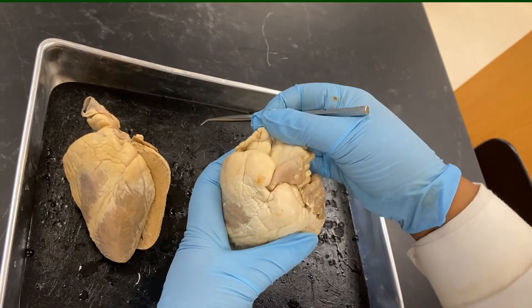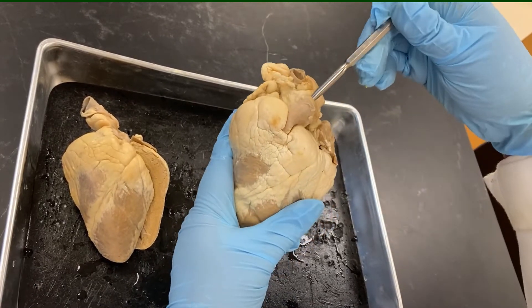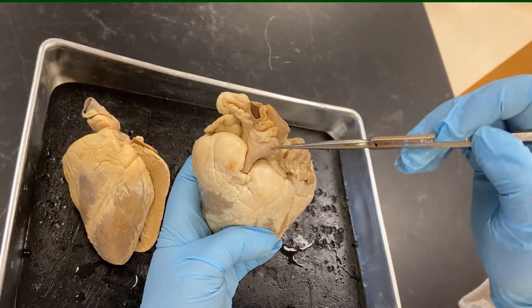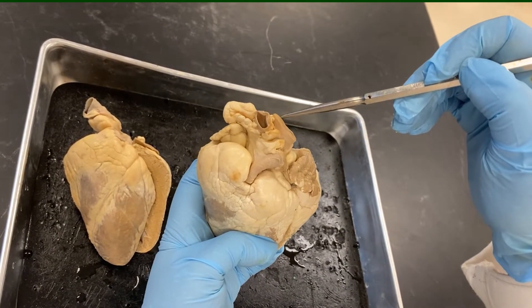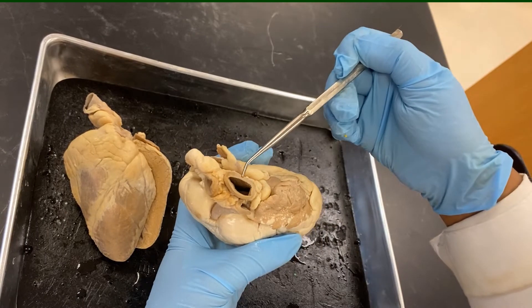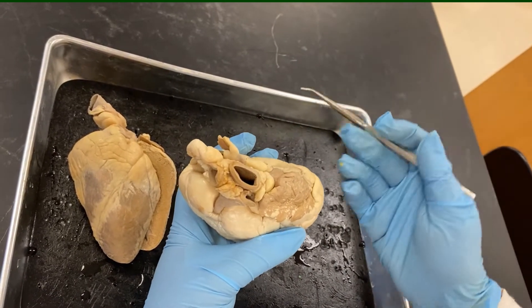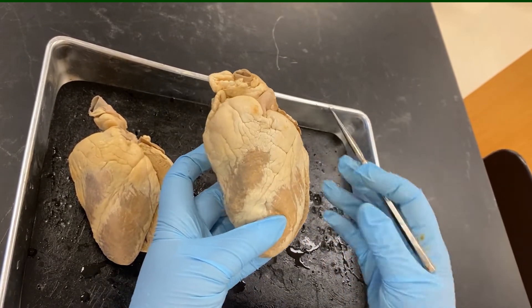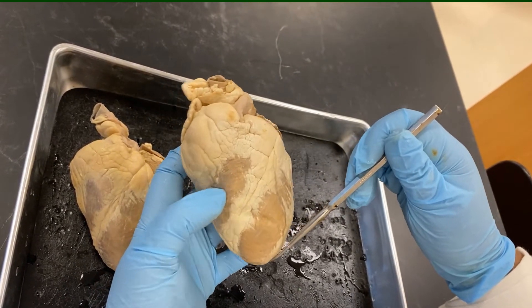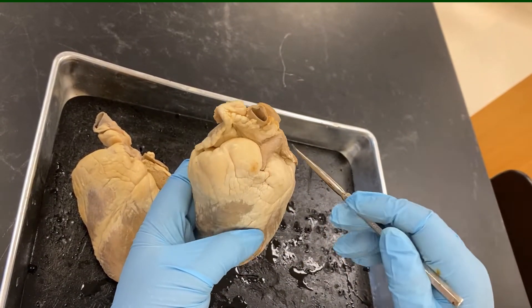This blood vessel, which is very distinct and most anterior, is the pulmonary trunk. Posterior to the pulmonary trunk is the aorta — look at that beautiful structure with the strong muscular tunica media, the muscular layer. We can see the four chambers. At the inferior part, this is the apex of the heart. Superiorly, this whole region is called the base of the heart.